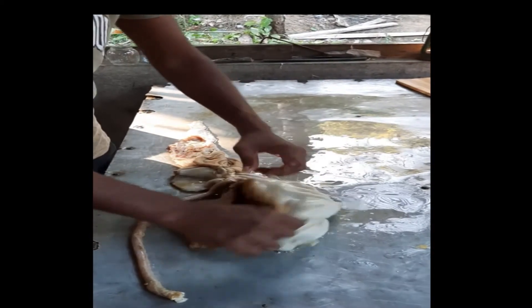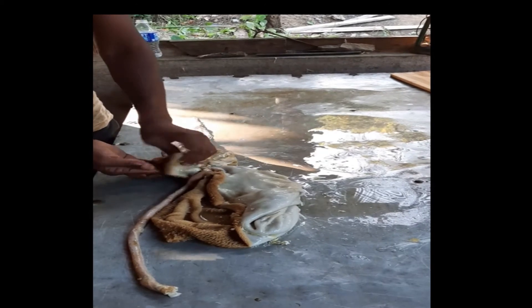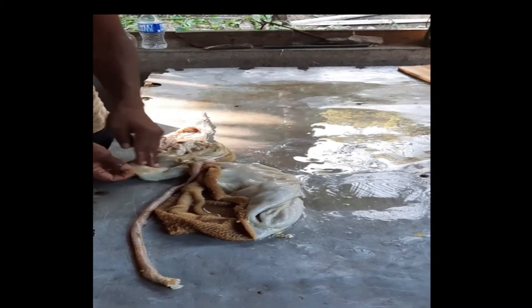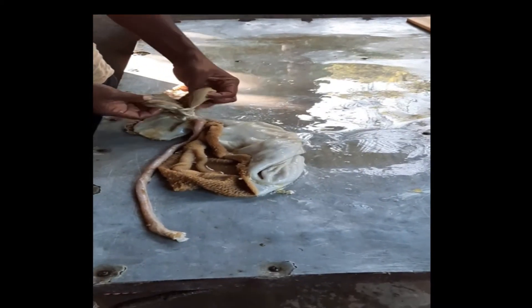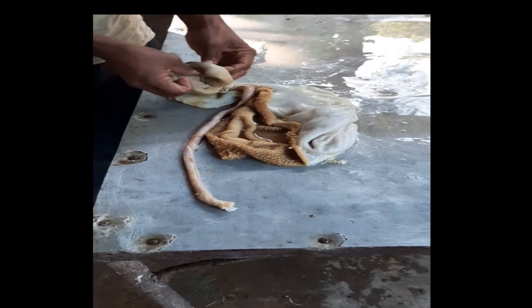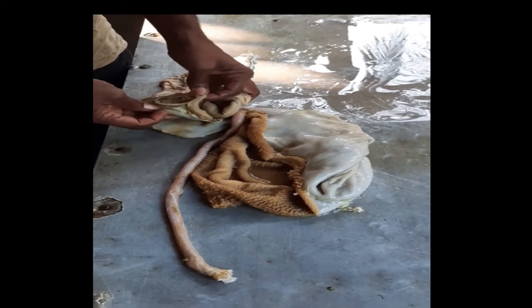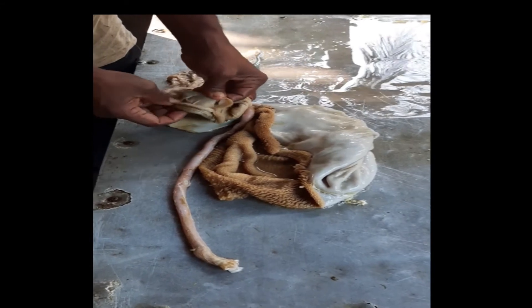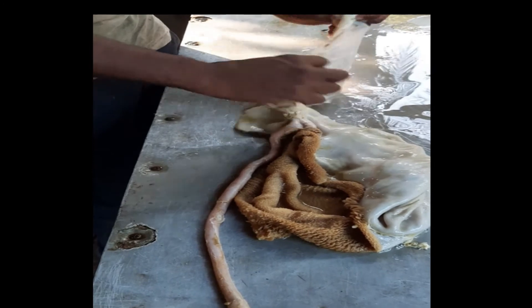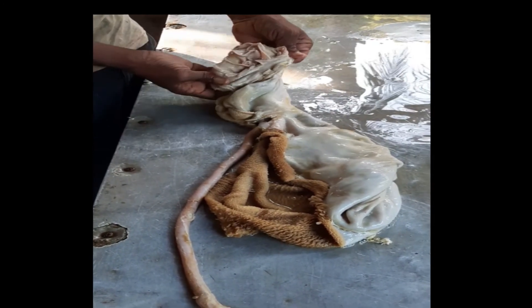Then you have the reticulum, which is this compartment right here. It's open and it looks like a honeycomb. Then the third compartment is the omasum, which has a lot of flaps or folds. And then the fourth compartment is the abomasum, which is this section, and this is the inside.